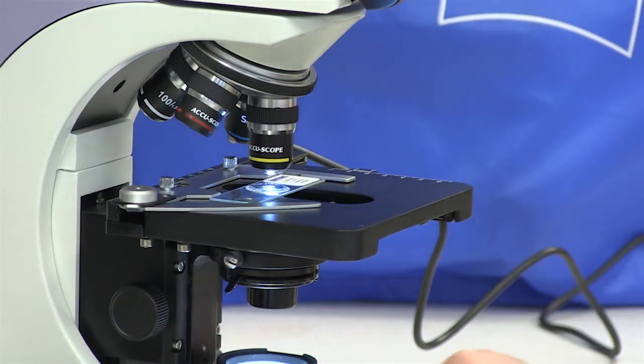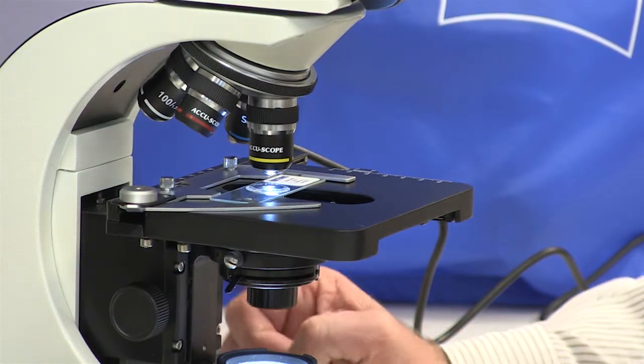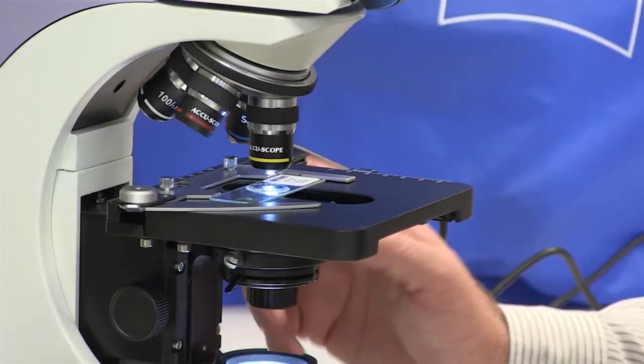The low power objective has a magnifying power of 10x on this microscope. I'll look through the oculars and use the coarse adjustment knob to get that thread into sharp focus.